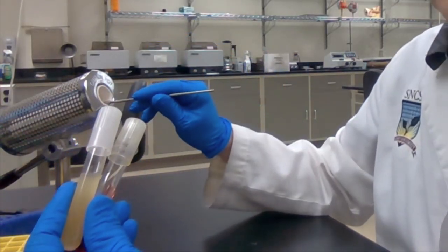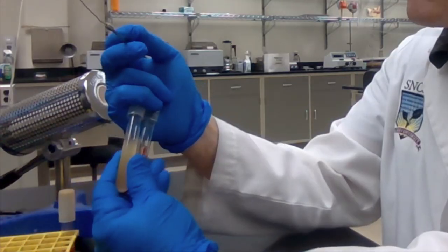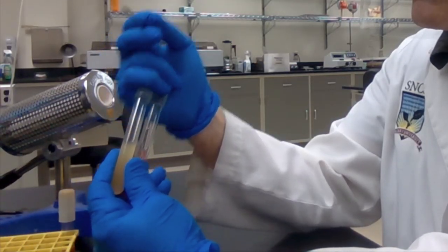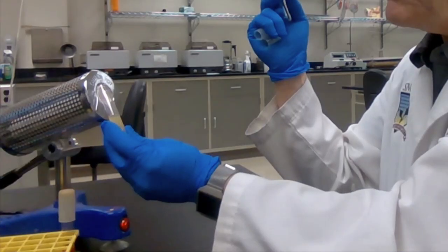The inoculation tool is sterilized. Caps are removed and held by the pinky finger of the dominant hand. They are never set on a surface.